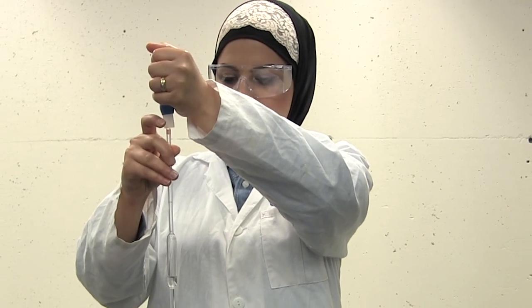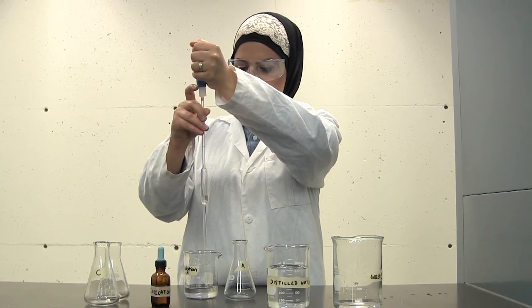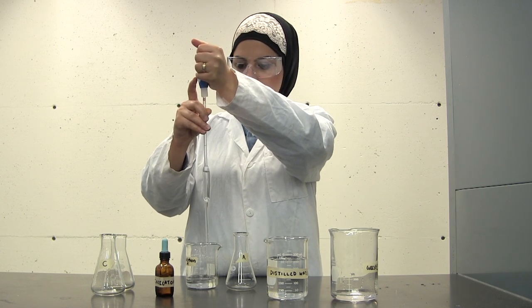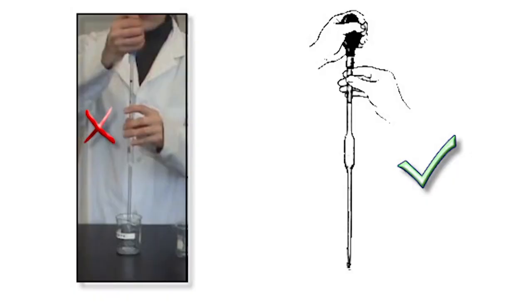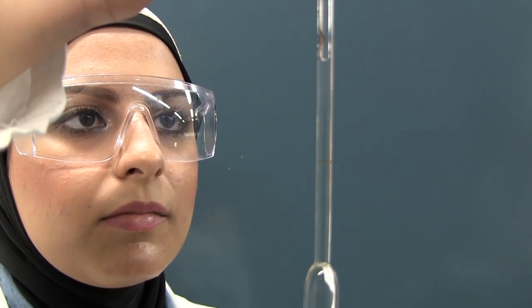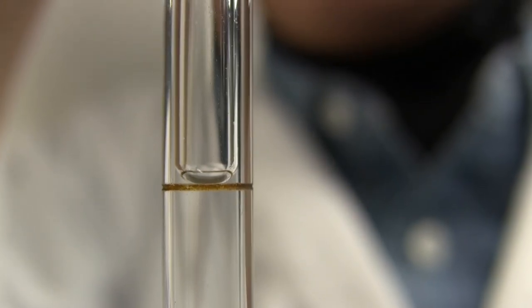After this, fill your pipette with titrant using your pipette bulb, past the graduation near the top of the pipette. You do not need to fill the pipette in one go — place your index finger on top of the pipette to re-evacuate the bulb and continue from that point. Do not hold the body of the pipette, as your hand will supply heat to the instrument and affect the calibration. Now raise the pipette to eye level over the waste beaker and slowly twirl the pipette so that the bottom of the meniscus is directly on the line.